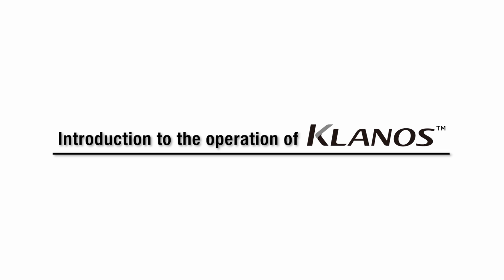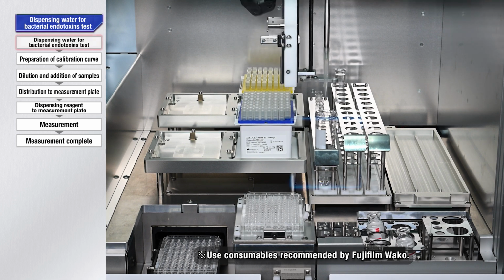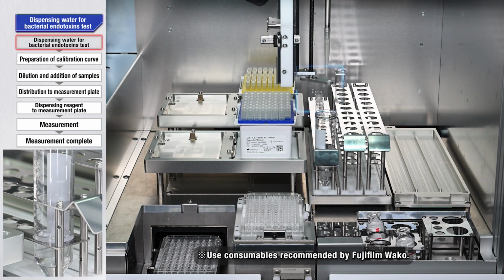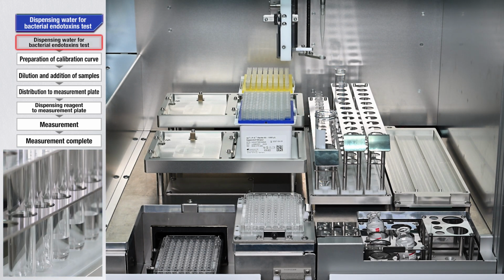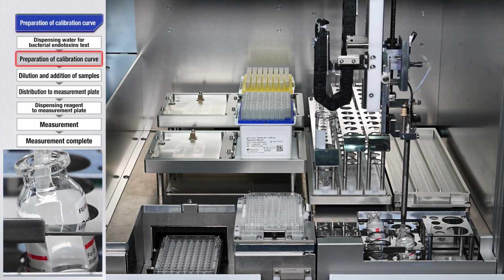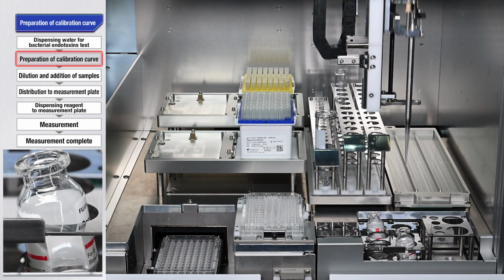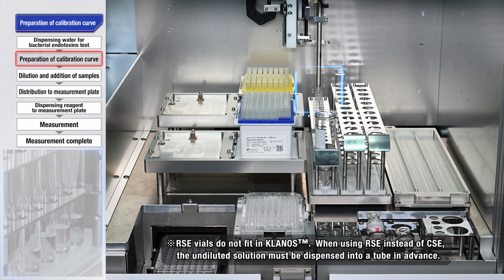Let's take a look at the operation of KLANOS. When the test begins, water for bacterial endotoxins test is dispensed in order to create a dilution series for the calibration curve. Next, a series of dilutions is made from the undiluted solution of the standard endotoxin that has been dissolved in advance, and a calibration curve sample is created.